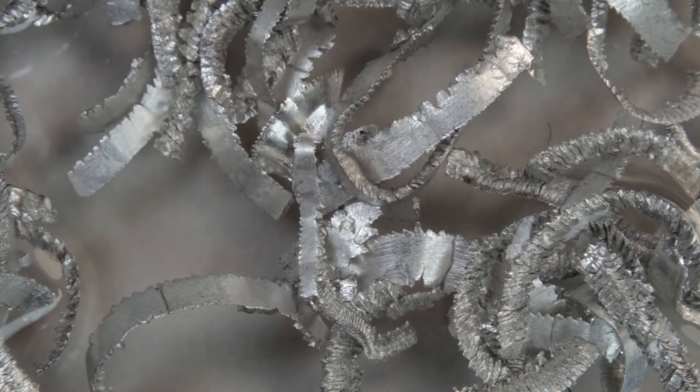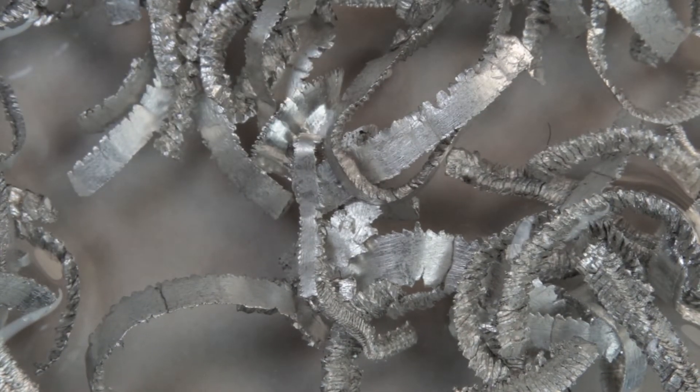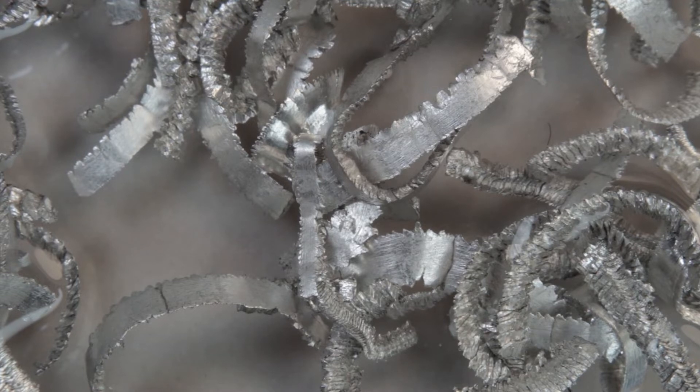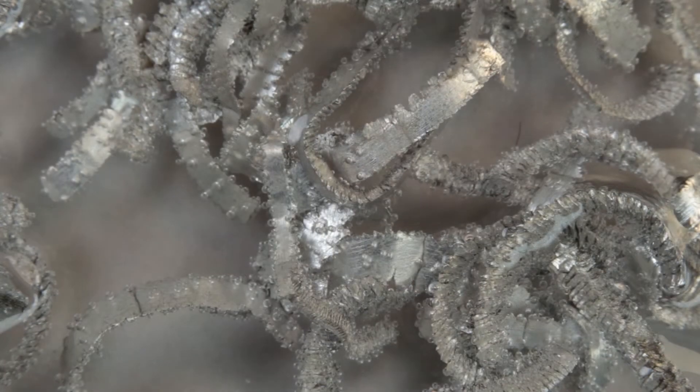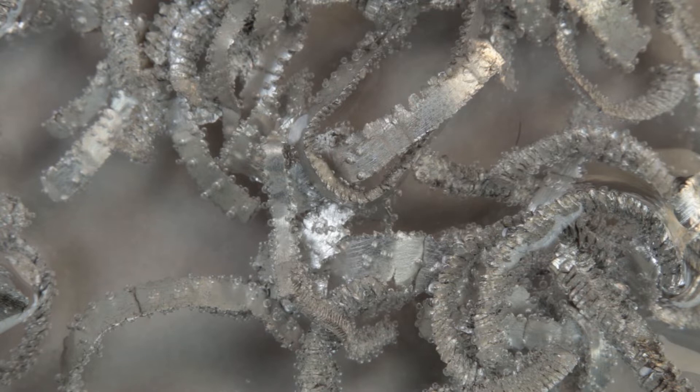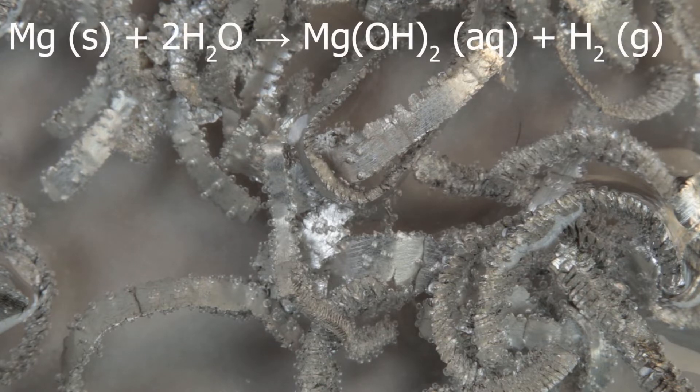No signs of reaction are immediately visible, but if you wait for a few minutes, you can see metal pieces are covered with bubbles of some gas which rises up from time to time. This is hydrogen.